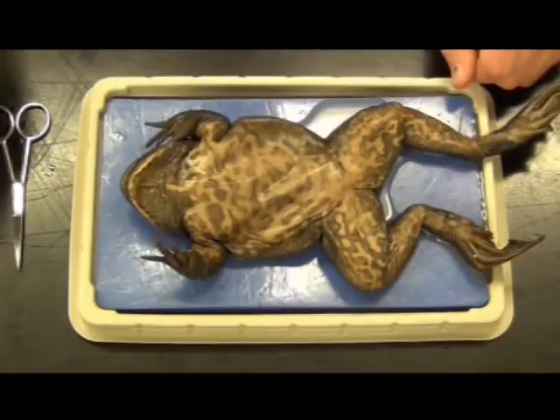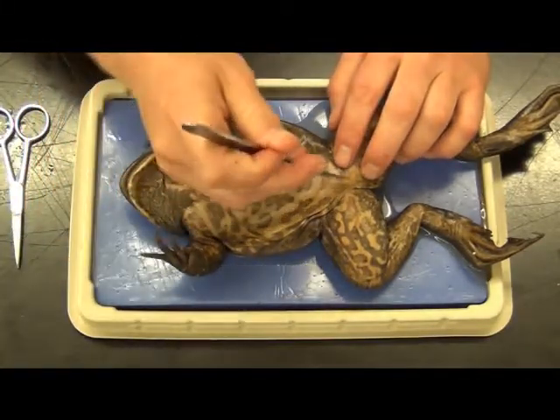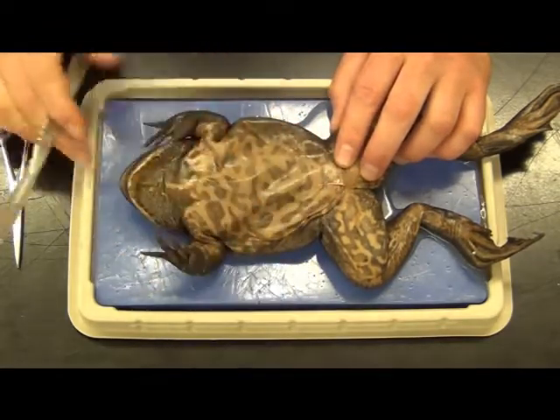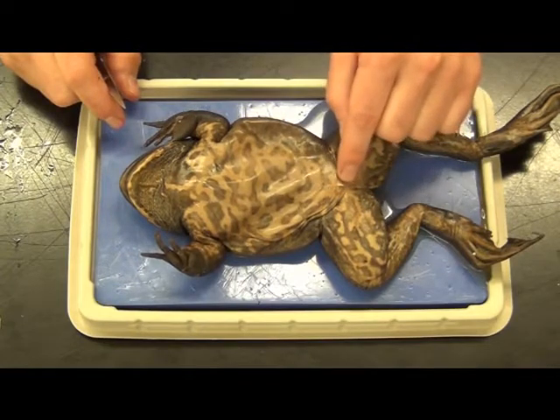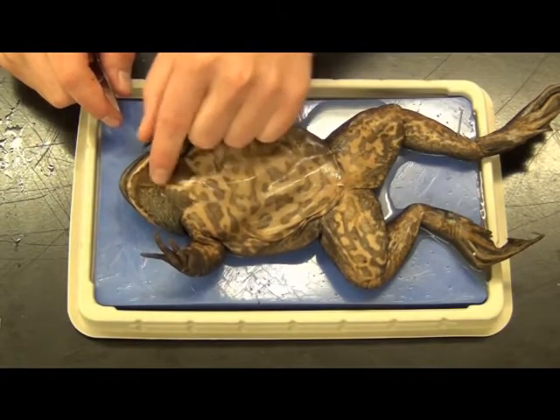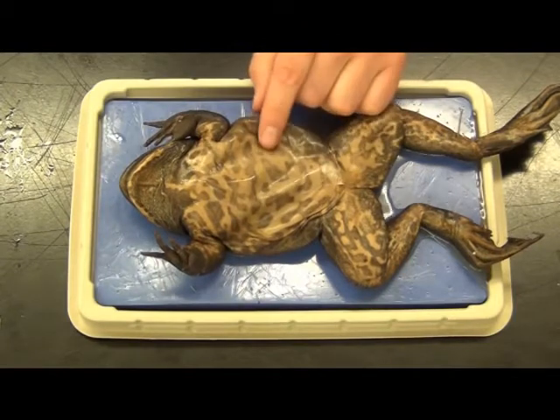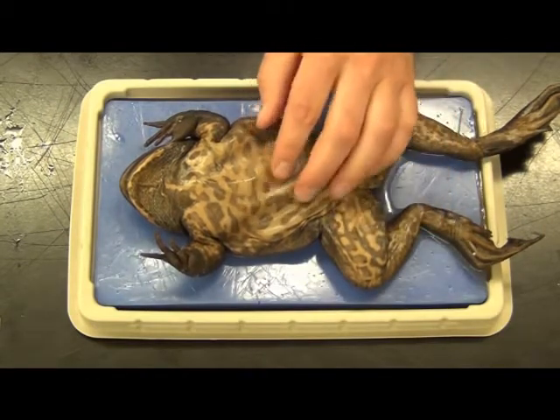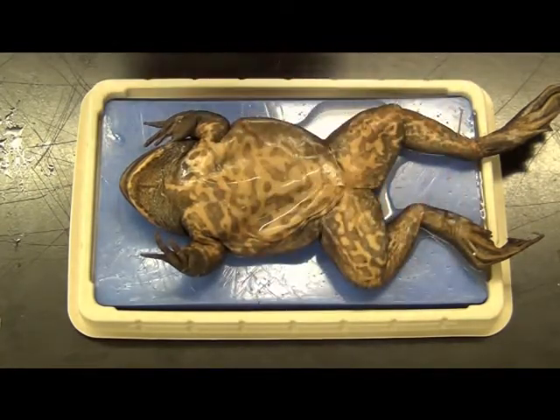Time to open up the belly. We're going to begin by cutting down close to the cloaca at the bottom of the abdomen. I'm going to make a small incision with my scalpel — very shallow — just enough to allow purchase with my scissors. The cut I'm going to make is from this abdominal cavity back at the cloaca, all the way up through the sternum and through the lower mandible. You want to be very careful because it's very easy to go through a liver or scramble some of the internal organs.